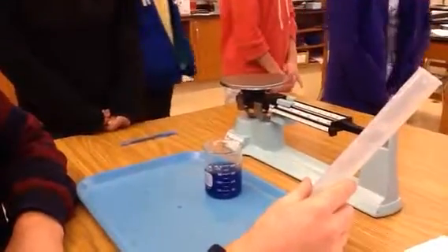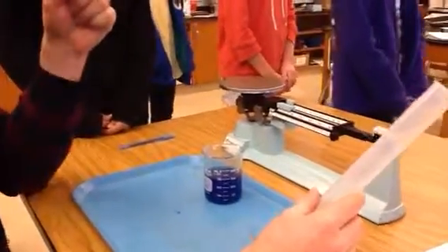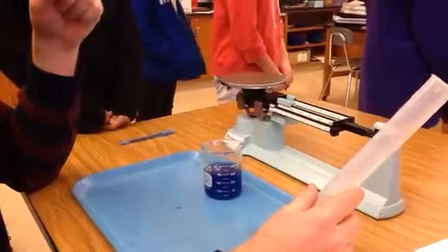So what are we starting with? What's up there on the board? You guys can answer. How much are we starting with? What's the first amount? 25. Good.